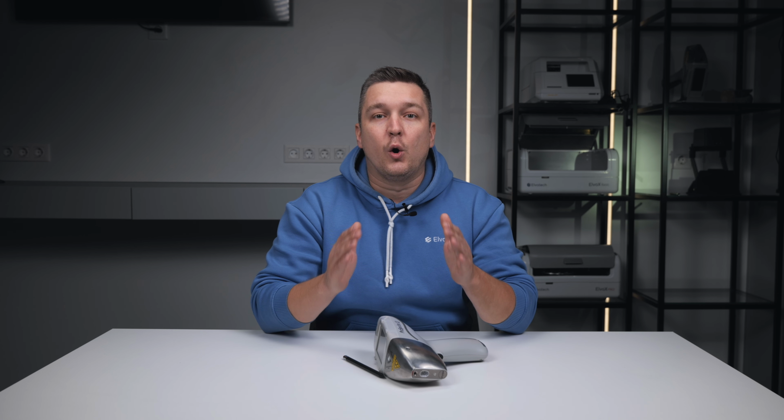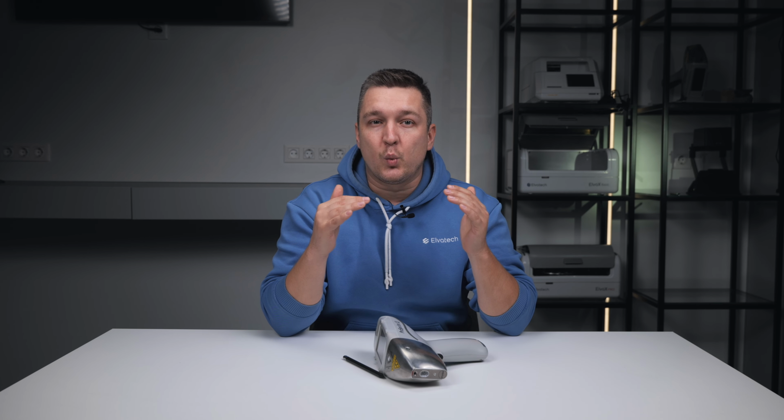Alloy grade, when you don't yet know what alloy it is. You need a quick answer. This is most likely this grade of alloy, with the match percentage. The analyzer selects the grade automatically. And now compare to alloy. It's when you already know and assume the grade and need to check compliance with the standard for all elements and their tolerances. In practice, these two modes are often used one after another.